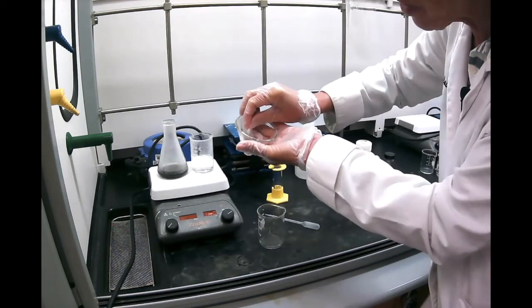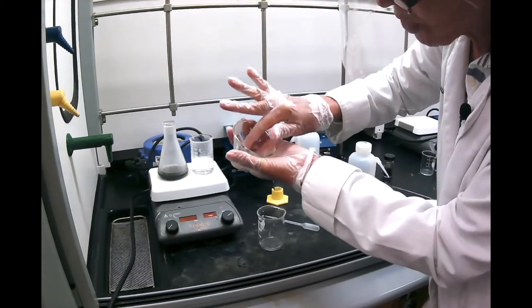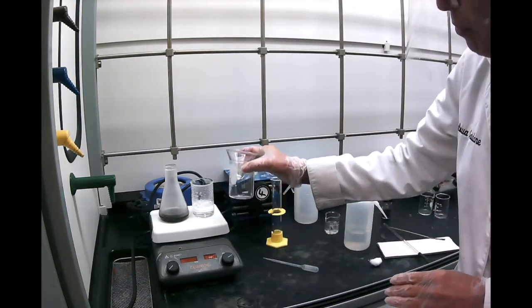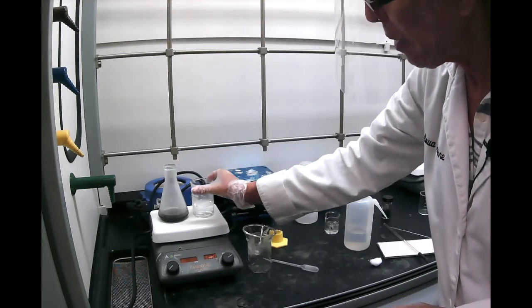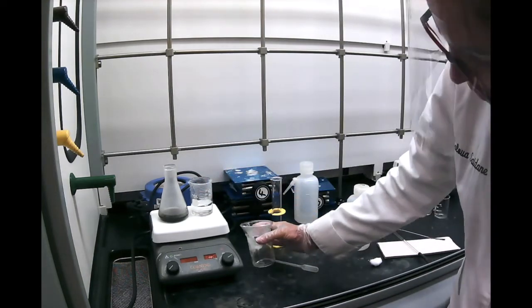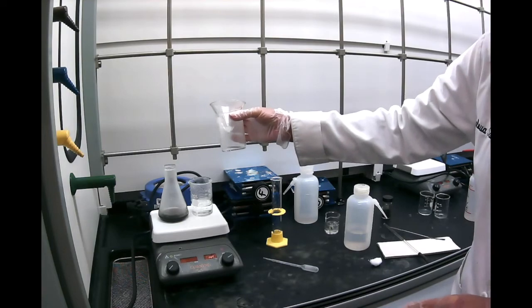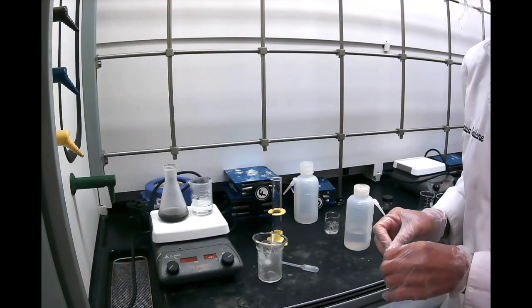So here's what I'm going to do. I'm going to take some cotton and put it in there and make sure that it's covering all the sides, and let's hope for the best. So now I'm ready to filter it while it's still hot. Maybe I can run a little hot water to see how it goes with the funnel. You see here, I'm just putting some water, and you see it's going slowly. So it's going to be a slow process. It looks like I put probably too much cotton, because if it's too slow, it's going to be painful.